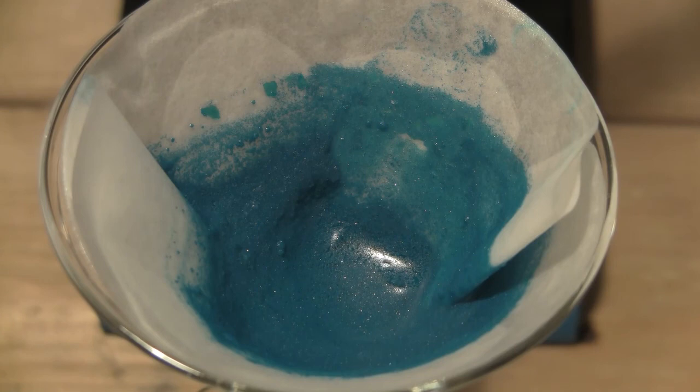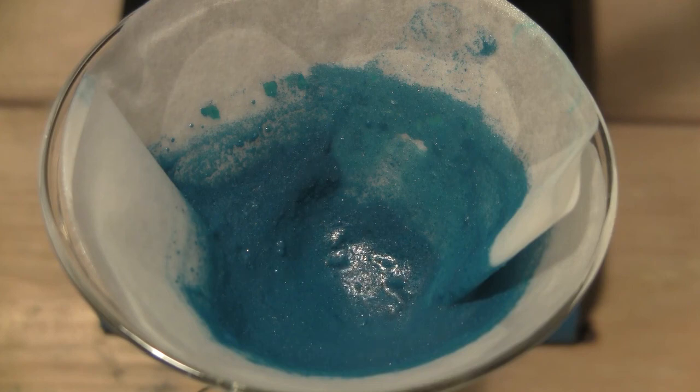The solution is then filtered and the salt is allowed to dry overnight, resulting in 1.536 grams, which correlates to a percent yield of 76.7%. This yield was decent, but it should be a lot closer to 100%. My only explanation for this is really due to my impatience in not allowing the sodium salt of ASA to fully react with the copper sulfate.